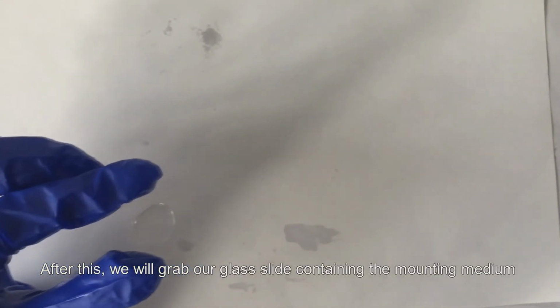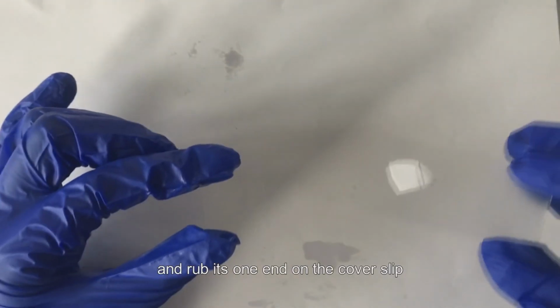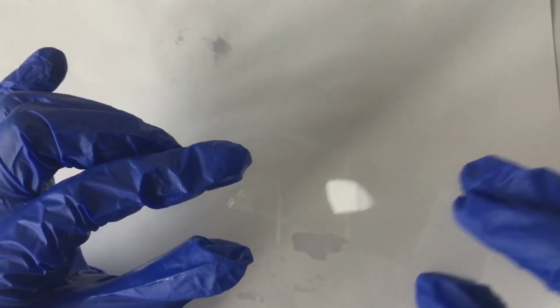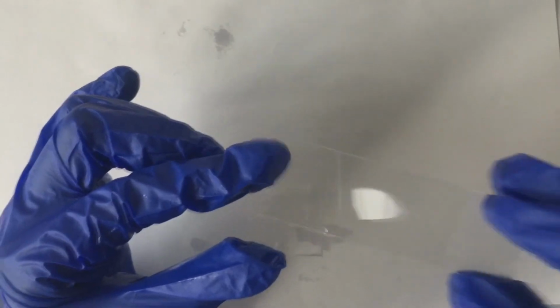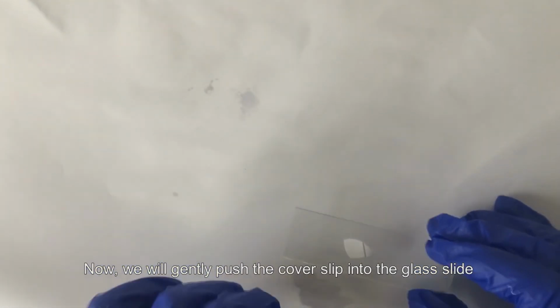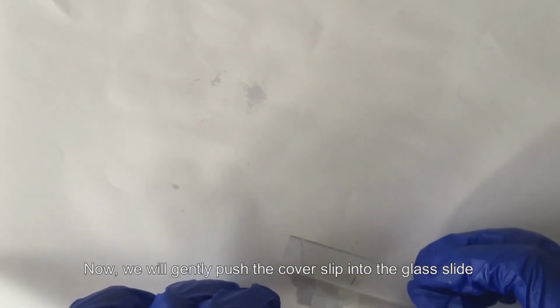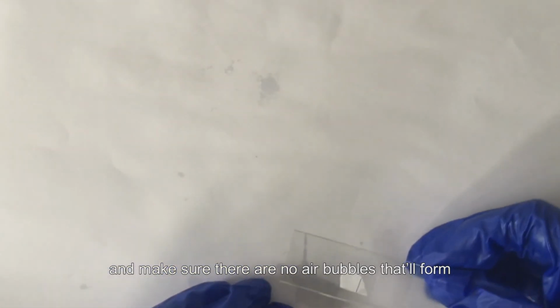After this, we will grab our glass slide containing the mounting medium and rub its one end on the cover slip. Now, we will gently push the cover slip into the glass slide and make sure that there are no air bubbles that will form.